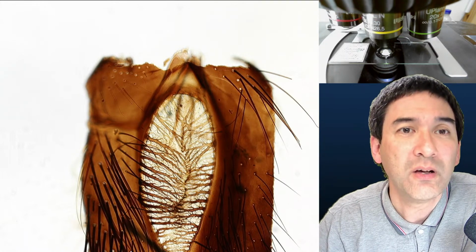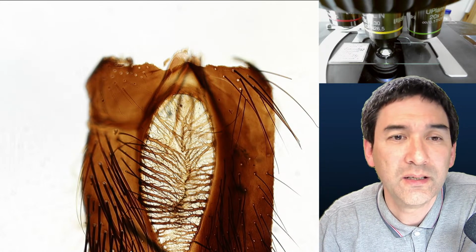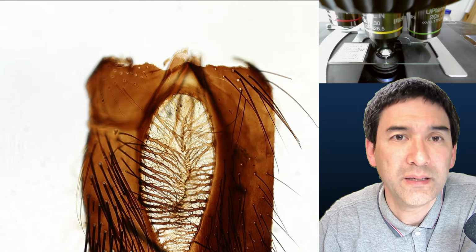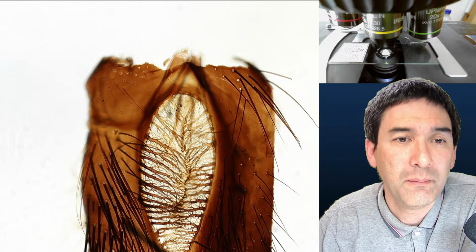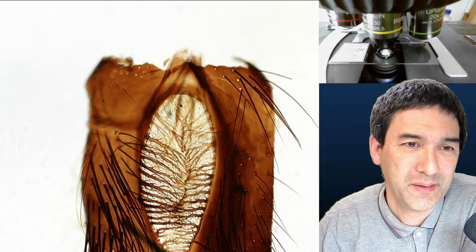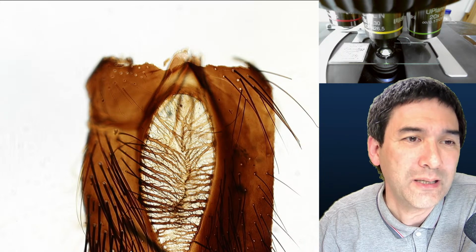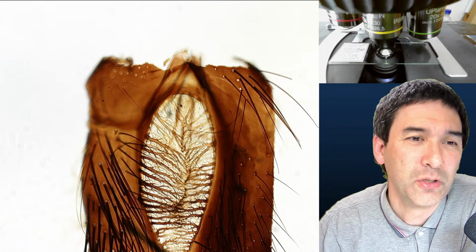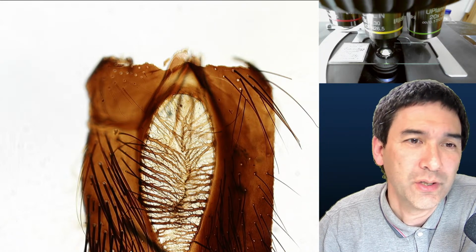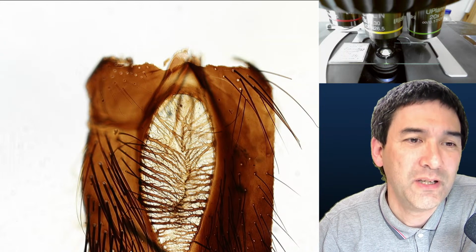Oh, of course, now you know, I click crop, and you get the idea, auto crop, and export. See, it's still a little bit blurry here because maybe this is motion blur. I've definitely been taking the video too quickly, because it somehow looks a little bit blurry in the vertical direction. That's motion blur. So my mistake. I made the video too quickly.